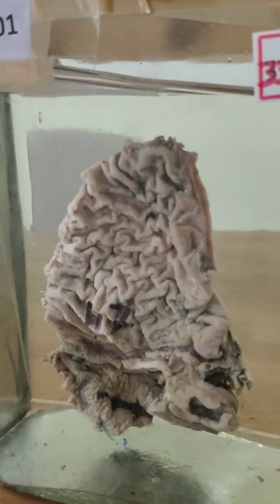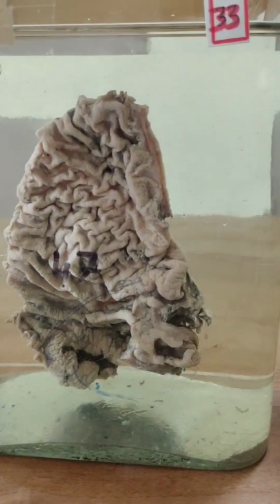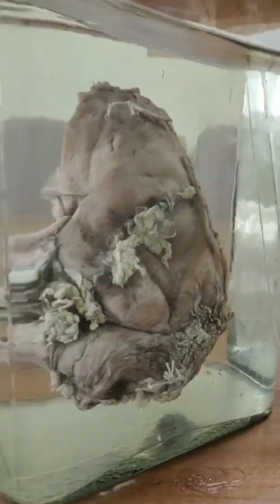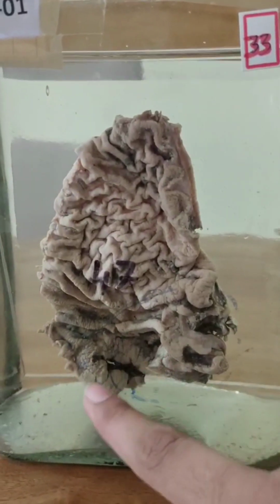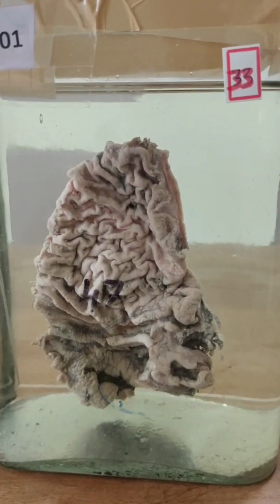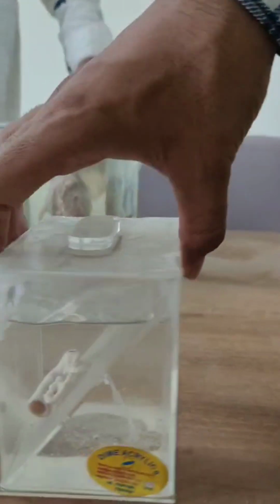So here you can see these are nothing but gastric rugae. So this is a gastrectomy specimen. Here you can see this is the pathology, and backside also pathology is there. You can see the lesser curvature, the greater curvature and the gastric rugae. So this is the stomach, and most probably this is stomach carcinoma. What are the types of stomach carcinoma? What are the risk factors? What causes stomach carcinoma? Everything about the specimen you should know. If they just tell you to identify the specimen, you should tell the specimen, or else if they ask questions, you should answer that also. Okay, so moving on to the most easy and most common one.